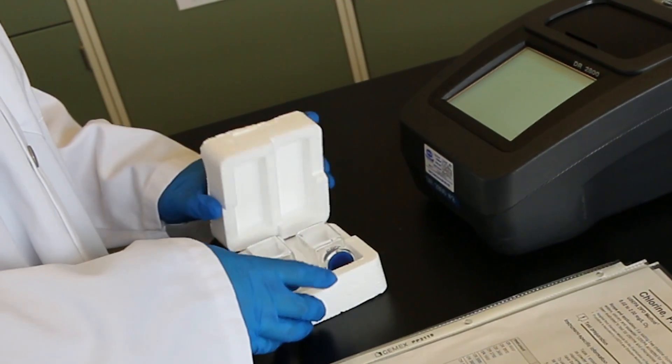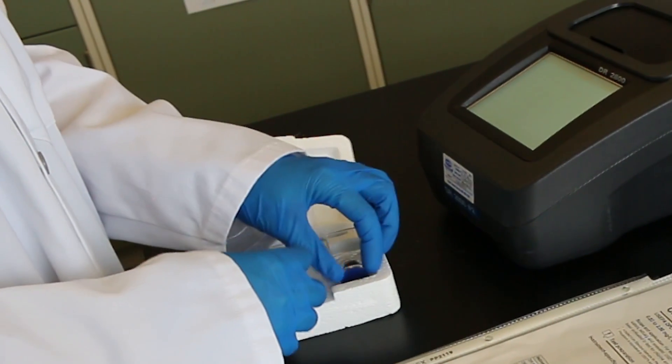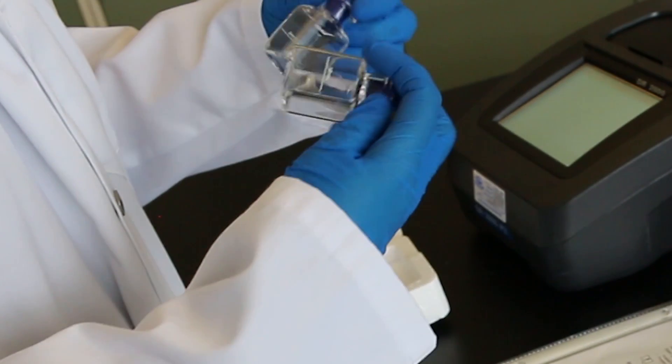Using the method for reference, locate the correct sample cells for the instrument you are using and note their proper orientation in the instrument.